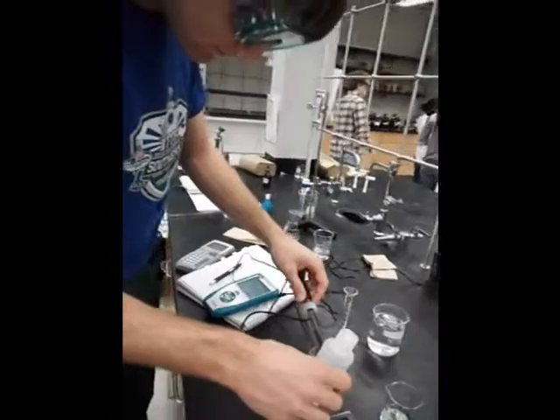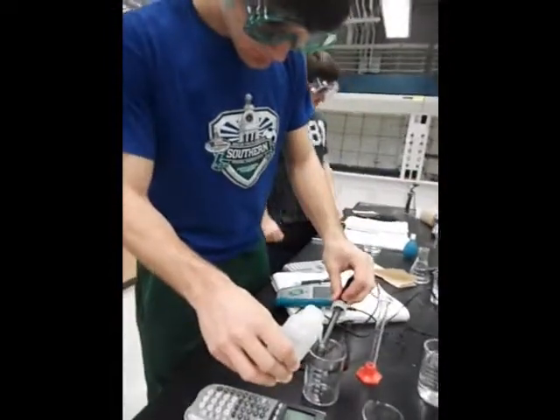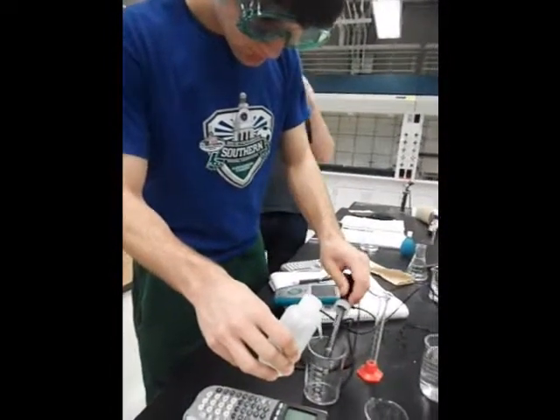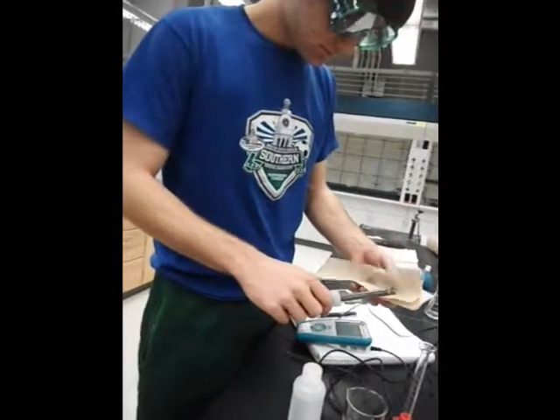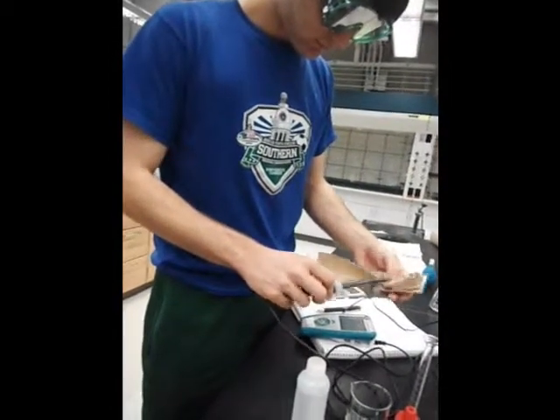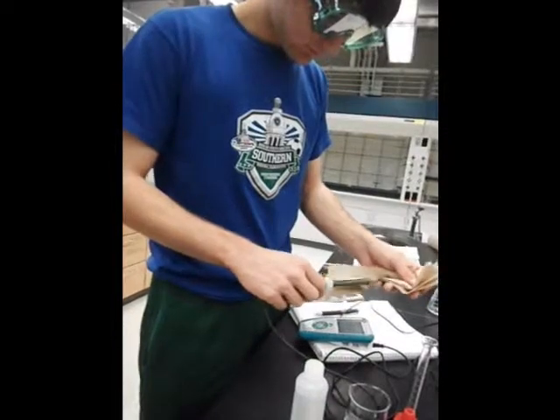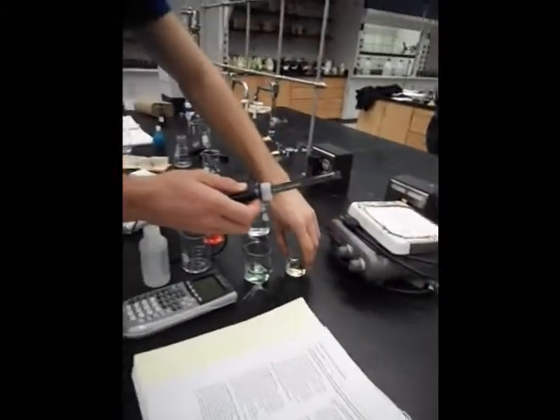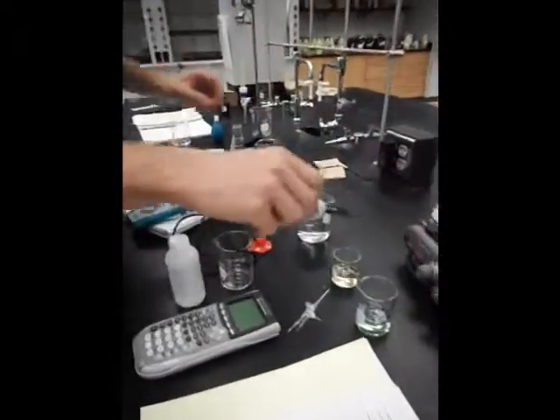Each time the calibrator is taken out of one solution, it needs to be thoroughly washed with distilled water. Make sure that the electrode is thoroughly rinsed off. The dabbing process used at the beginning should be repeated again.